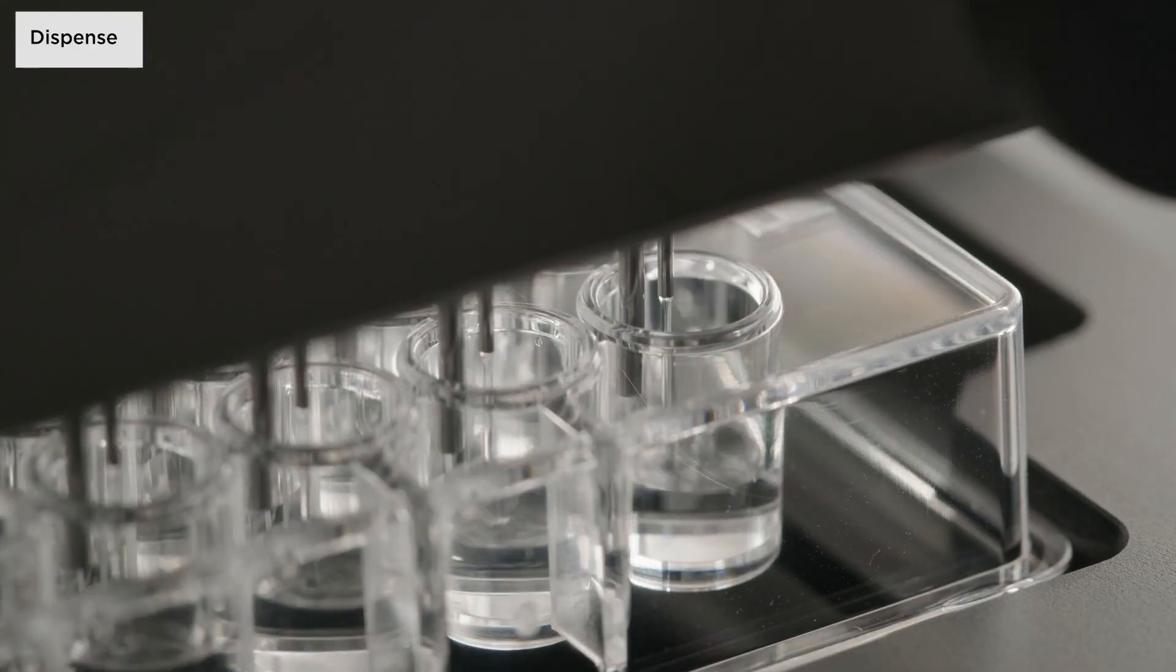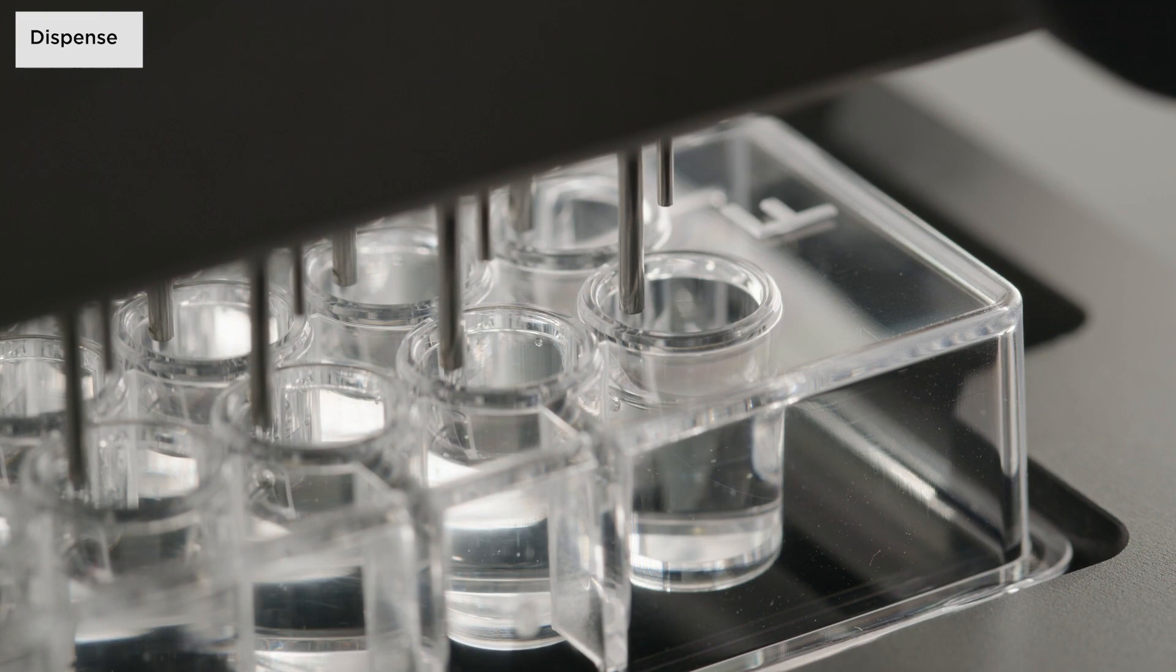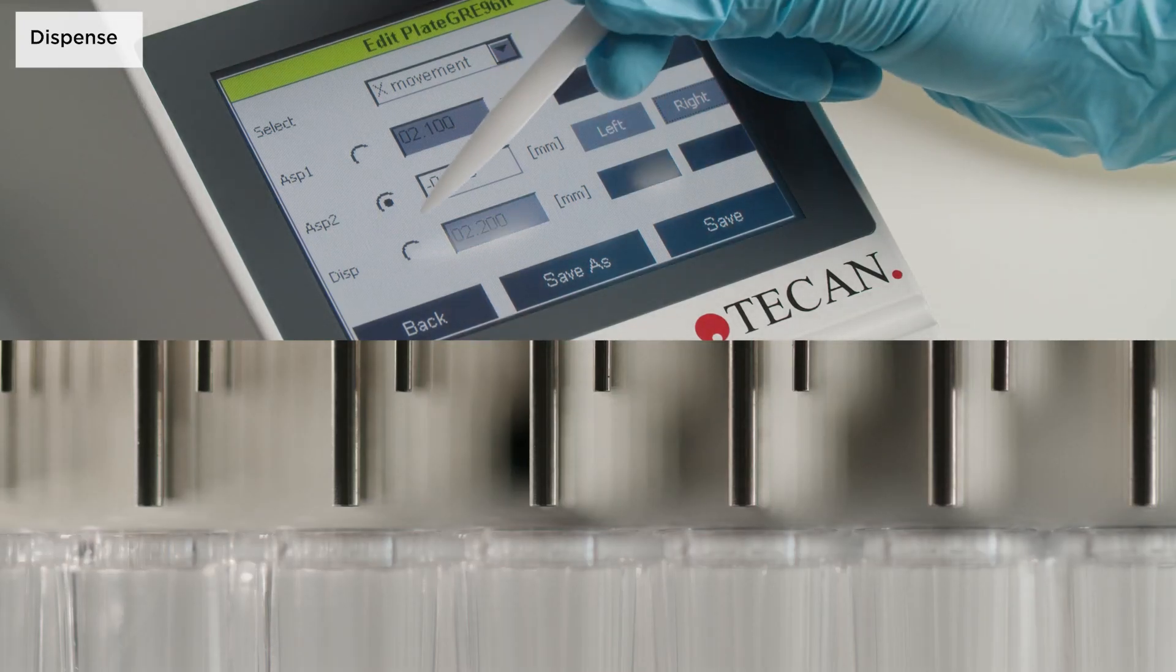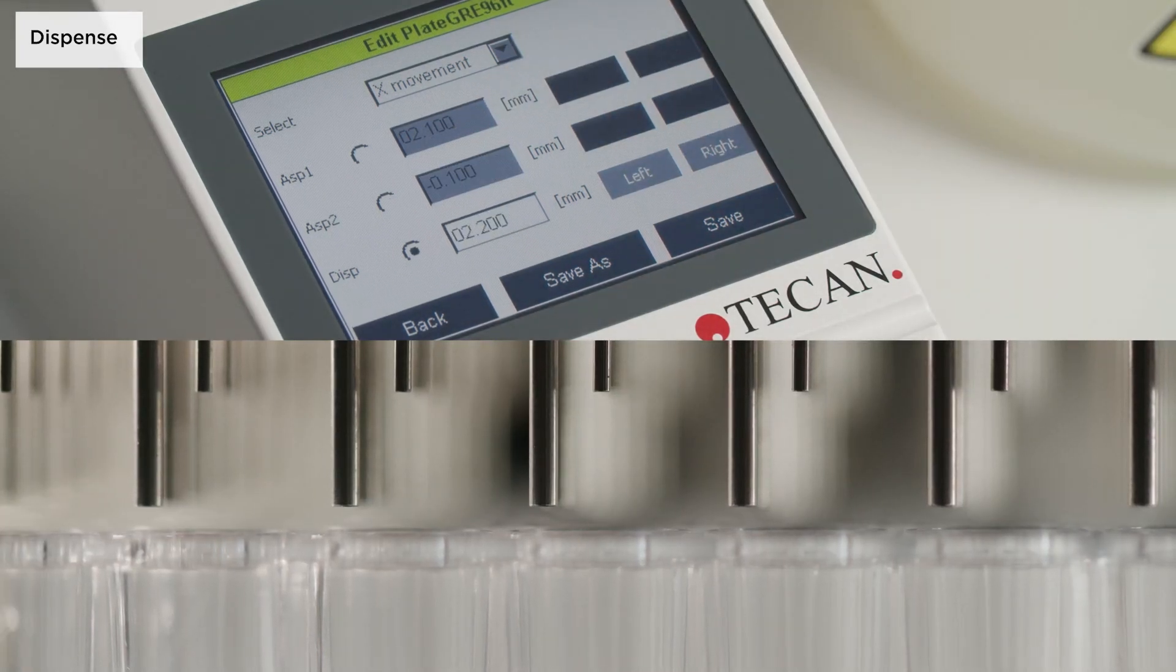The dispense position is available for all plate types and the dispense needles should be set as close as possible to the centre of the well.